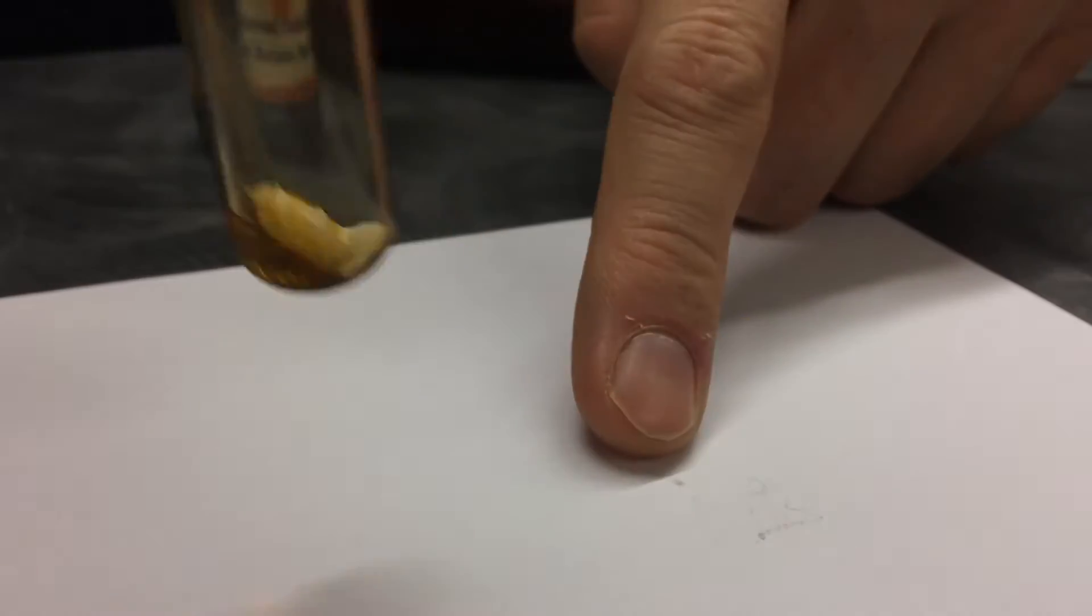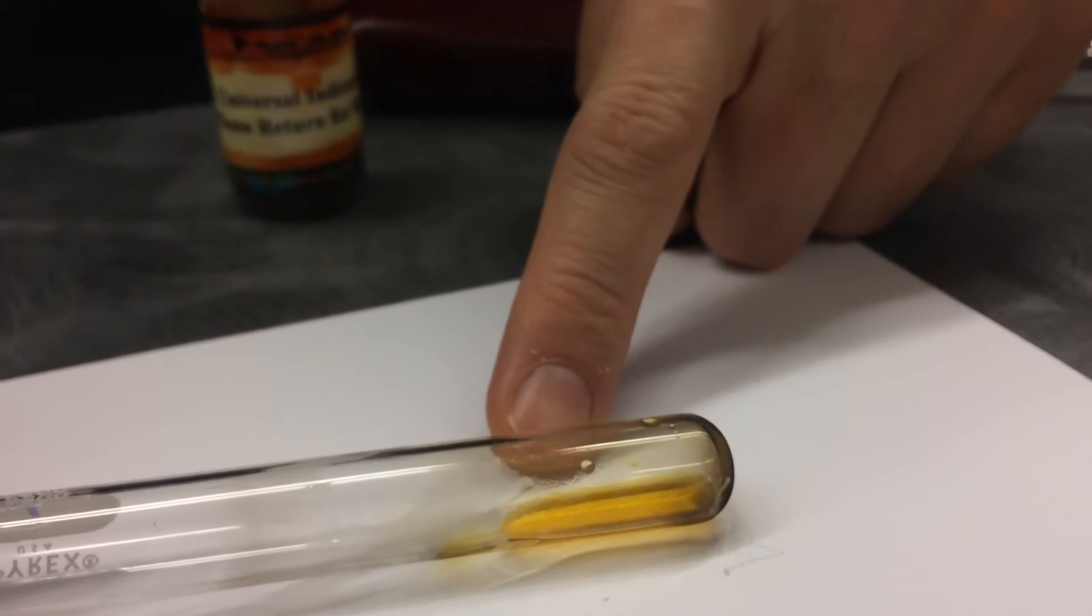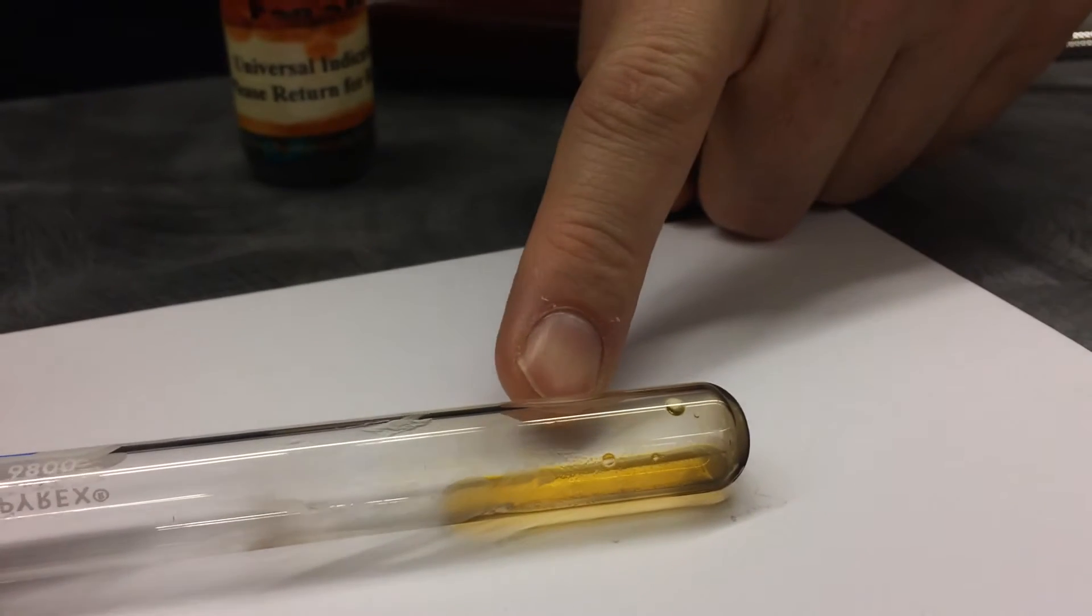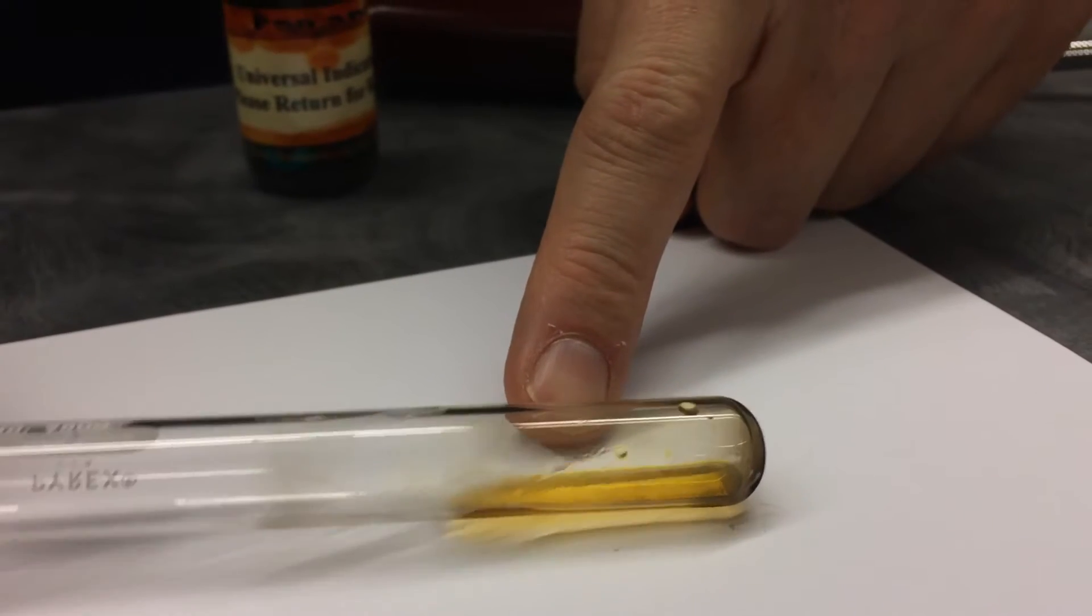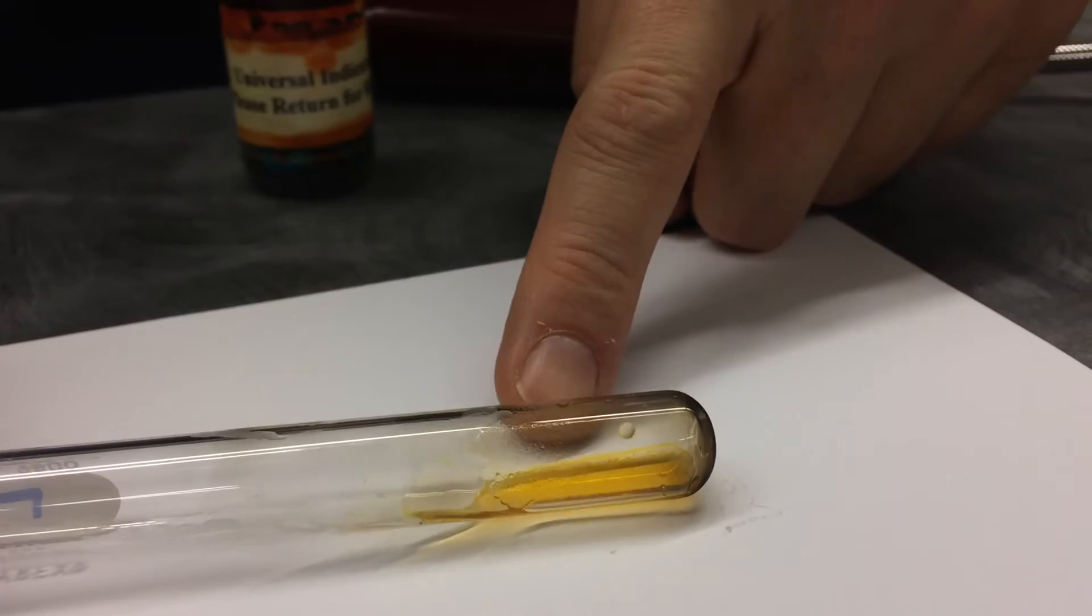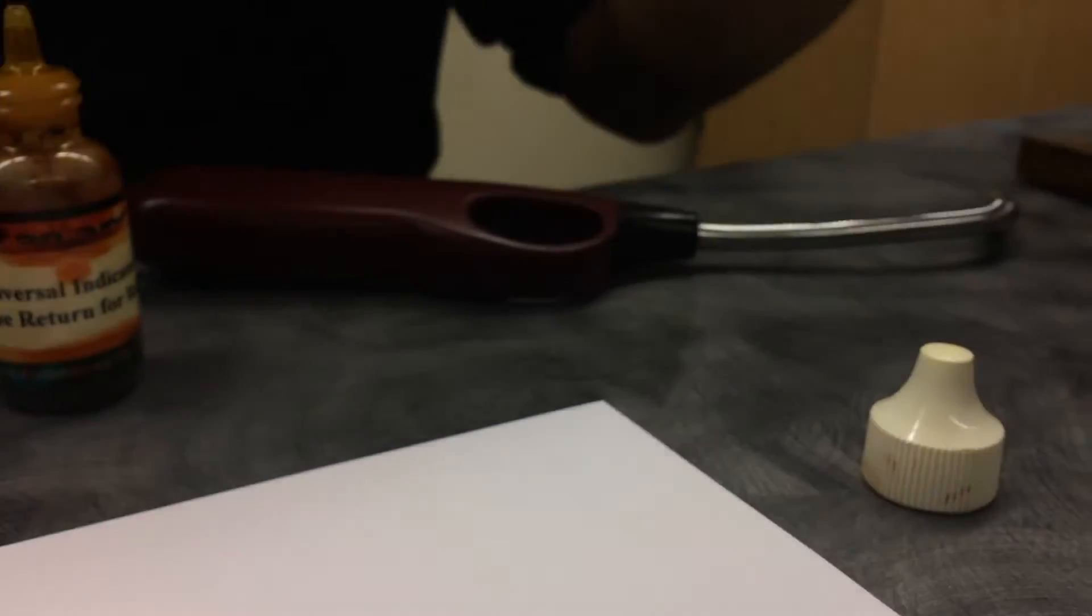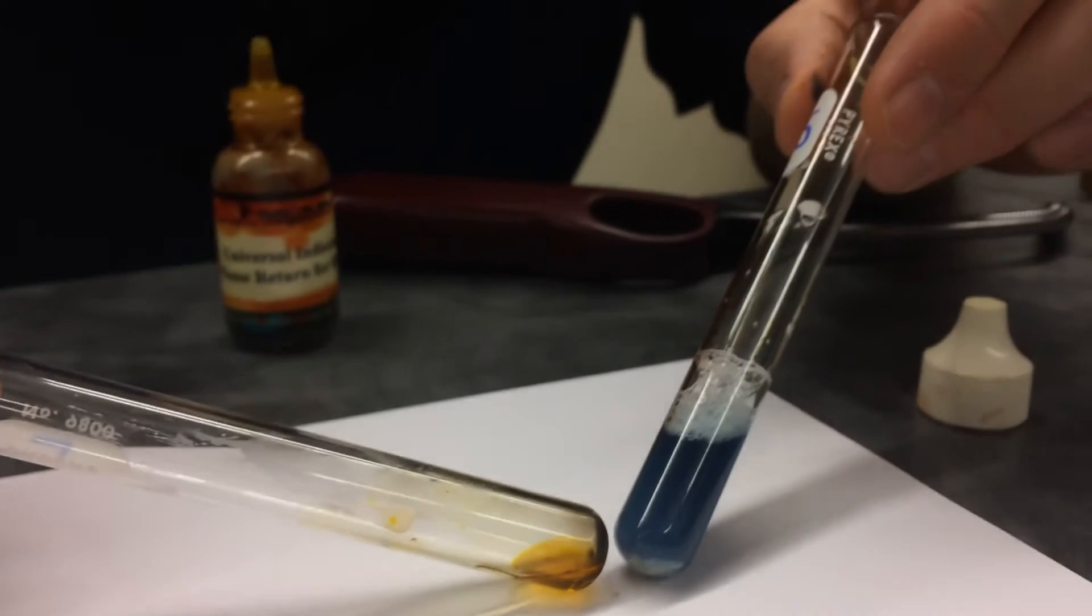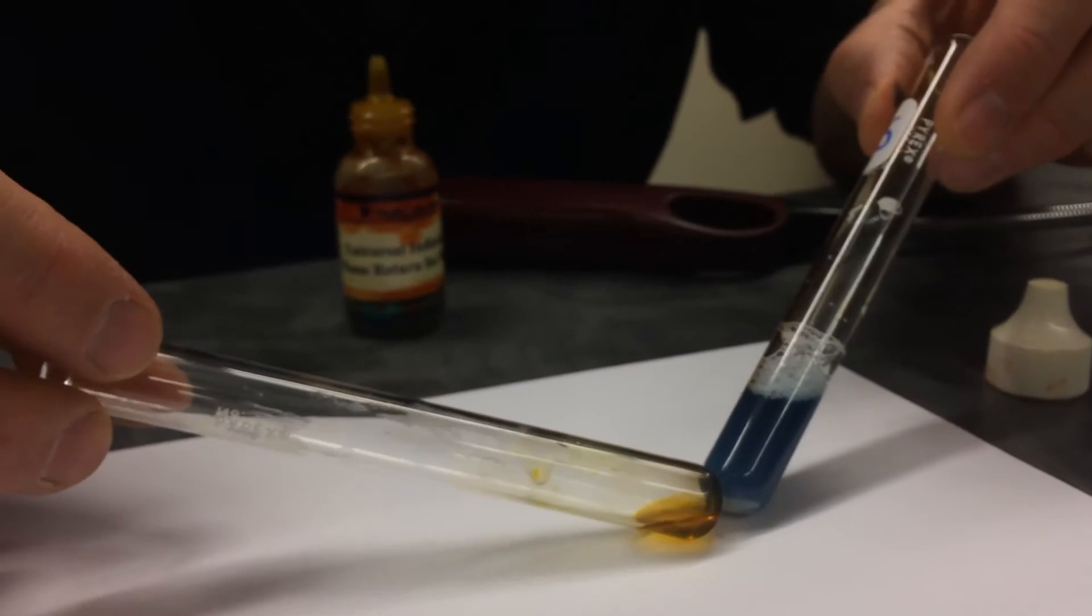That's funny you say that, Mr. Evans. Because we had some type of way to figure out what pH level orange was. So what pH would you assume that is, given the color that it turned? It definitely is not blue. So that is really good news for us, because as scientists, then we can do something with this data.